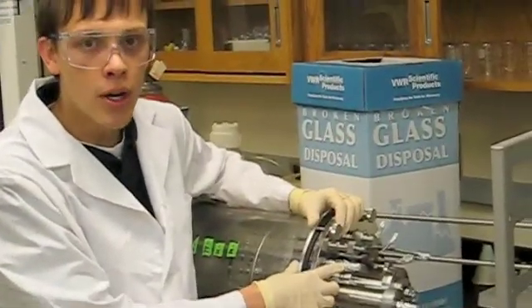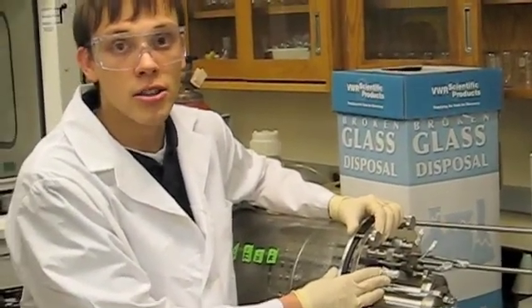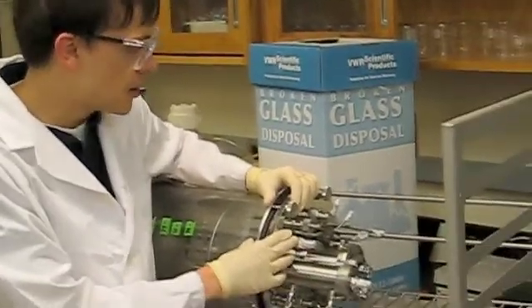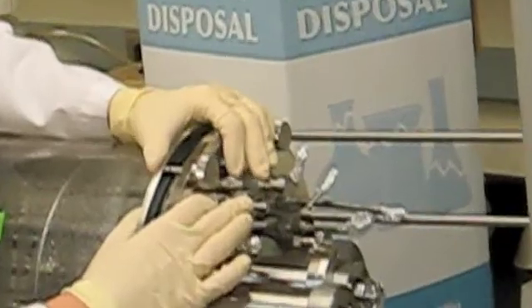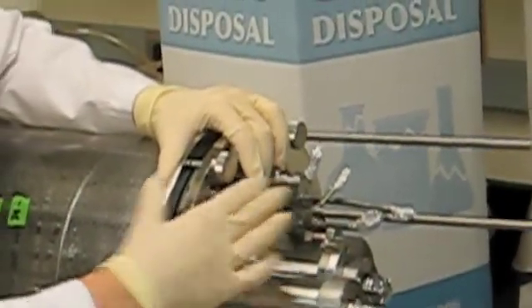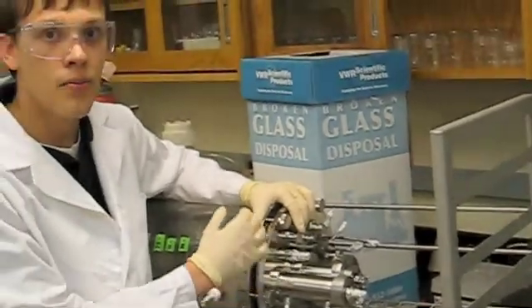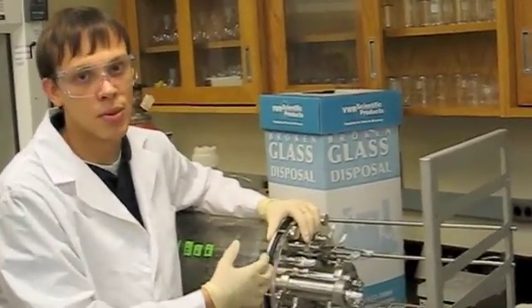Next, we have our thermowell port, which is where our thermometer will be inserted. Then we have our pH and our DO ports. There's two of these ports for pH and DO on opposite sides of the lid, and they're used for different sized probes.